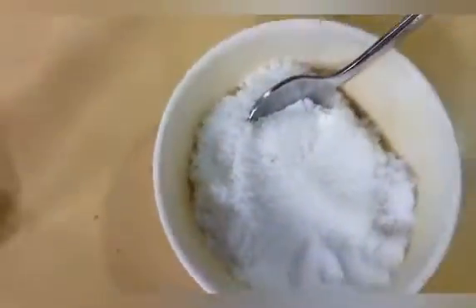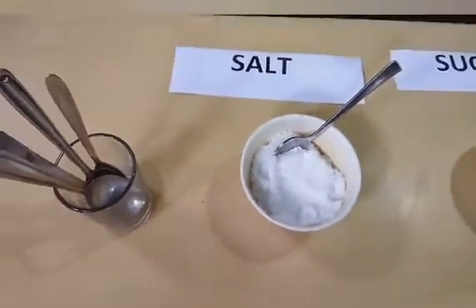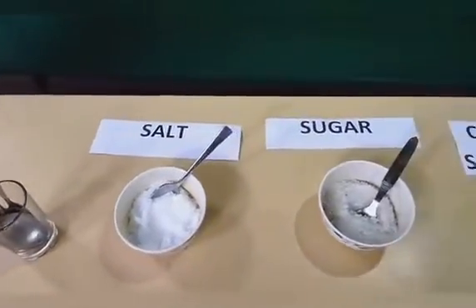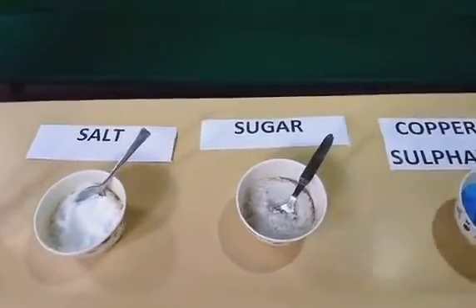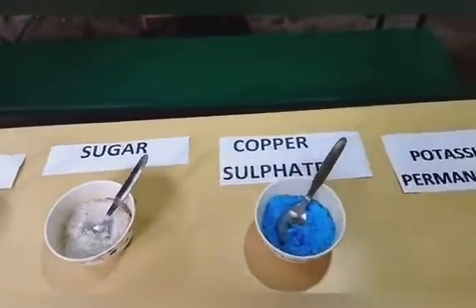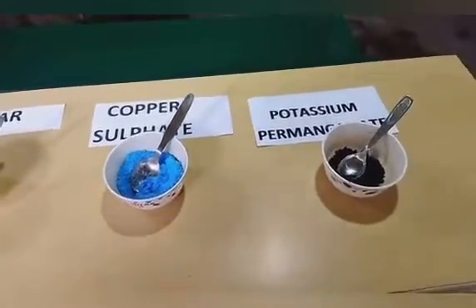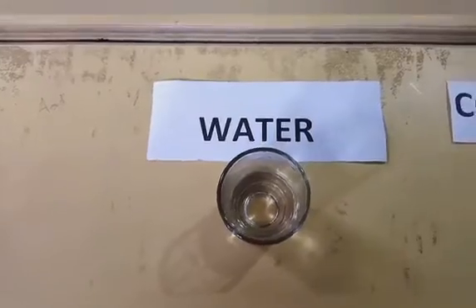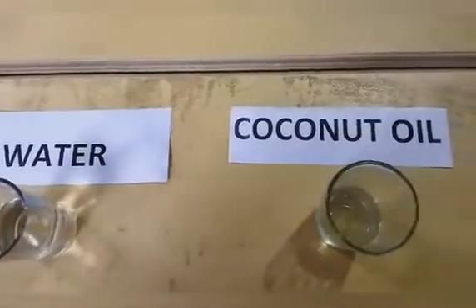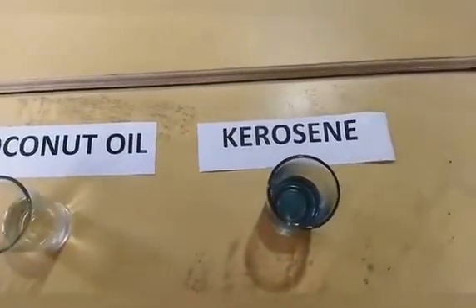Now we do an experiment to prove that water is a universal solvent. Materials required: salt, sugar, copper sulfate, and potassium permanganate as solutes, and water, coconut oil, and kerosene as solvents.